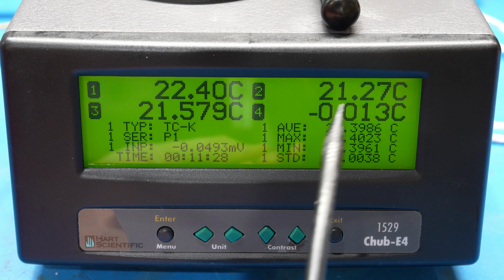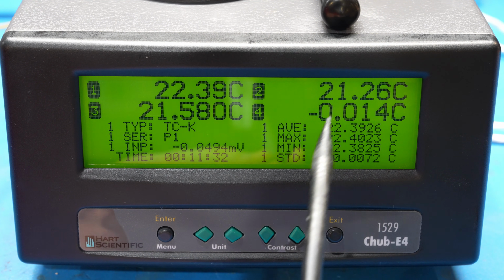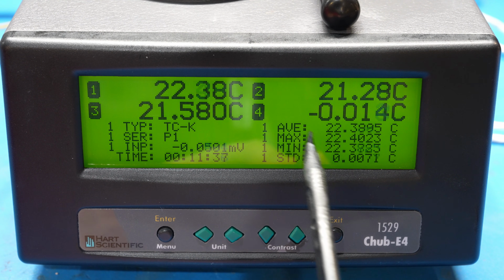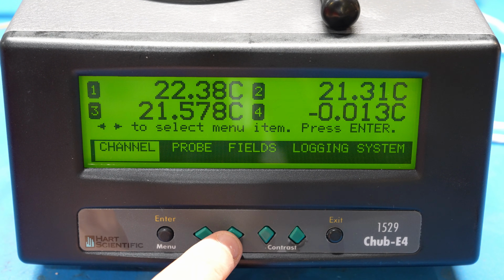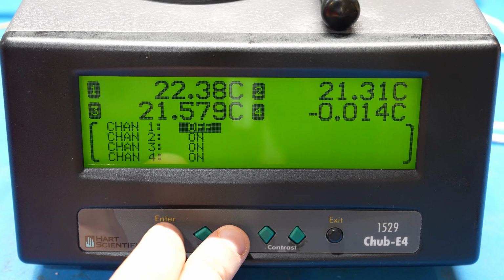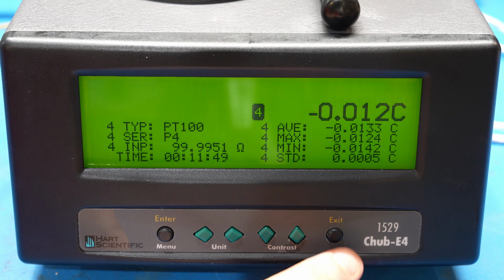So we do have 2 thermocouples, showing 22 and 21. And this is our PRT, 21.58. And this is our precision resistor. Look at that. It's almost 0 Celsius. So in fact, if you go through the menu, select the channels, and turn all the other channels off, we should be able to see the exact reading of that channel with all of its information.